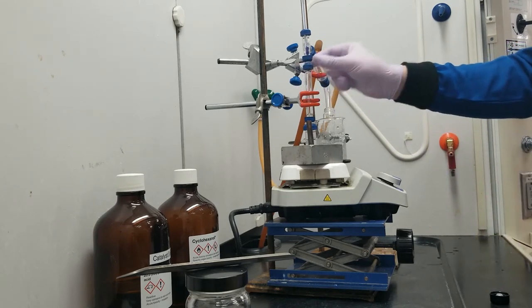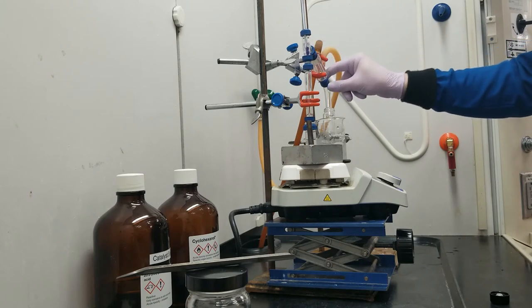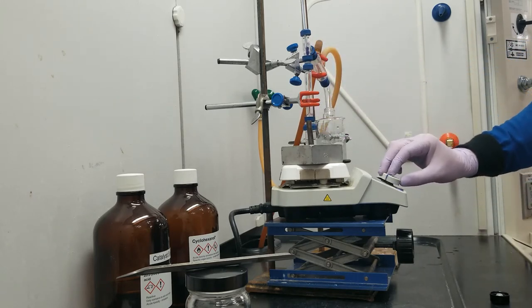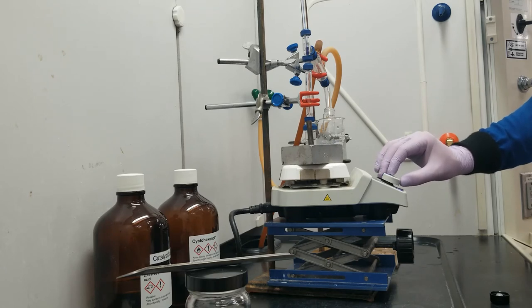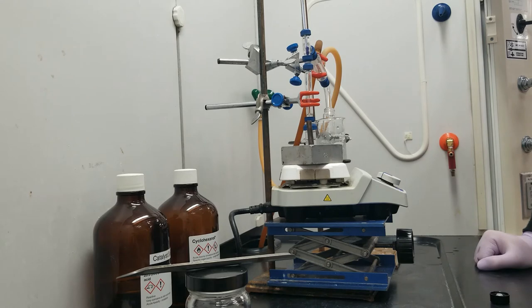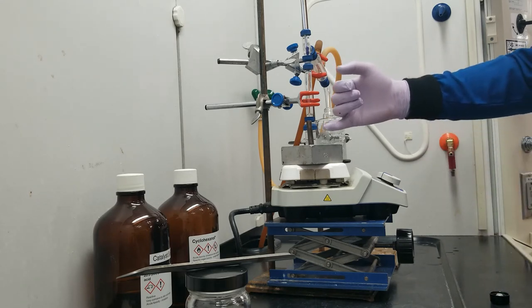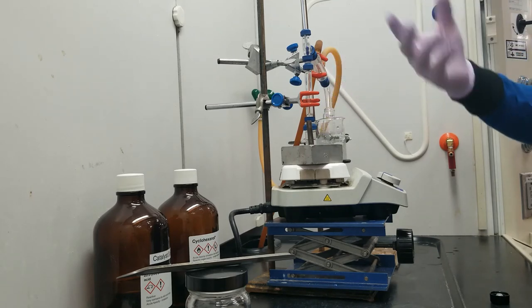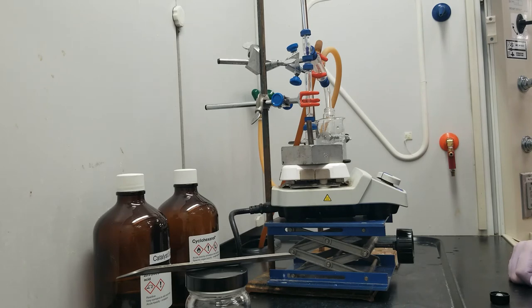So with this all set up and my joints are nice and tight, I'm going to go ahead and heat this up to 300. And I'm going to be looking for signs of reflux in my reaction flask including clouding of the glass here as vapors come up and condense on the sides of the glass, as well as a gentle bubble in the reaction flask.